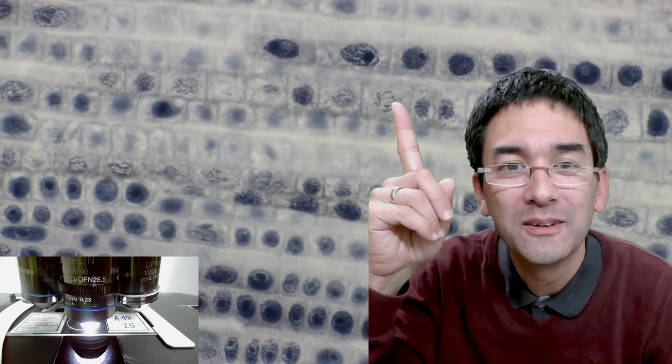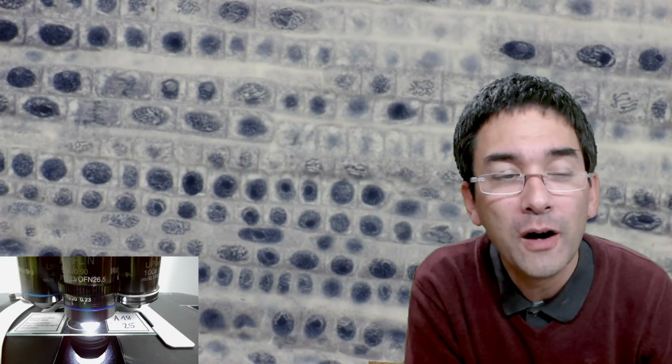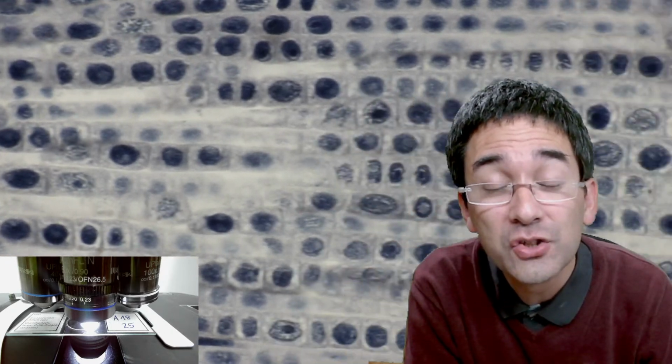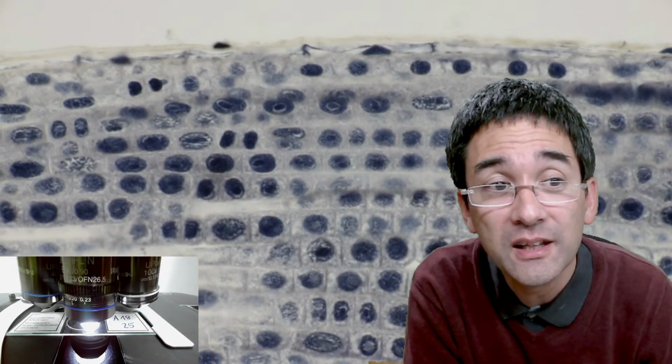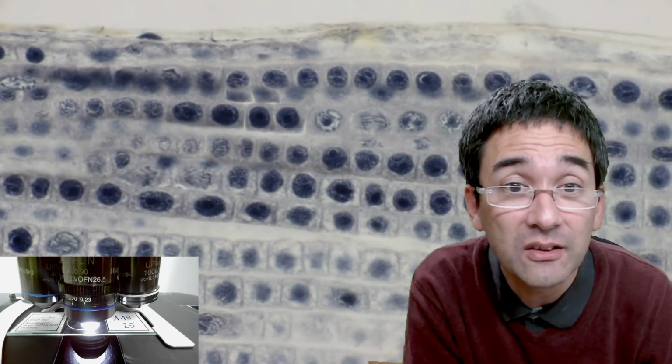And very nice prophase over here. You see the chromosomes? And what I've been doing with my students is I made them count cells. For example, they have to count 100 cells and then tick off how many of them are in prophase, metaphase, anaphase, and telophase. The more cells you find in a certain stage, the longer the phase. So you see that most cells here are in interphase, and this means that interphase is the longest phase of the cell cycle.